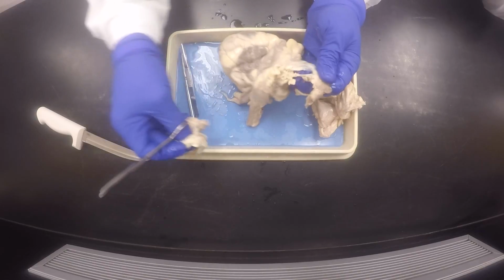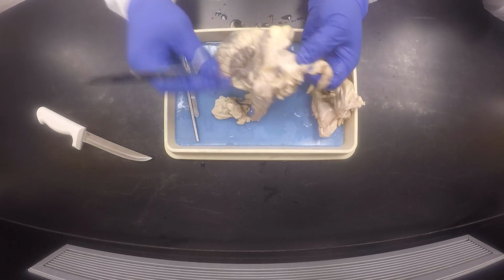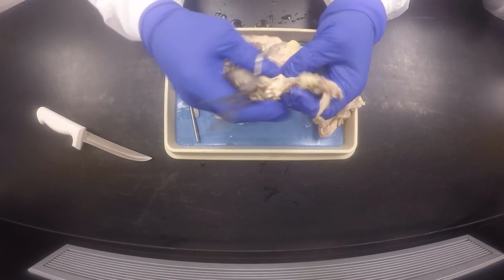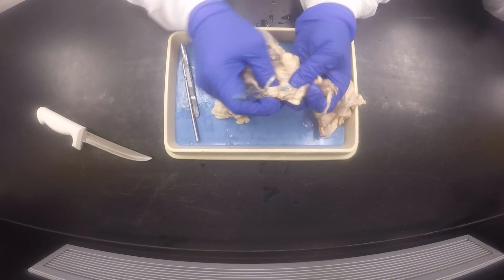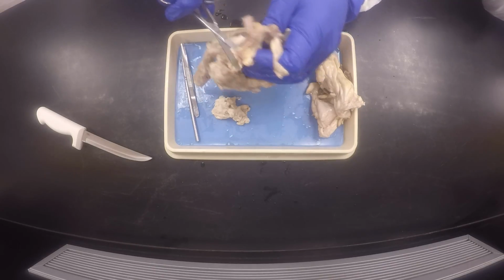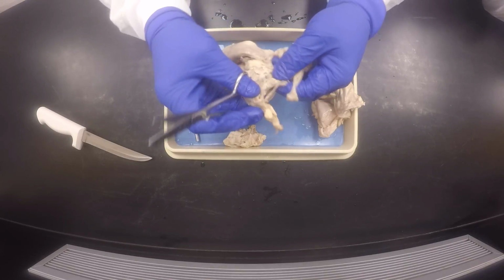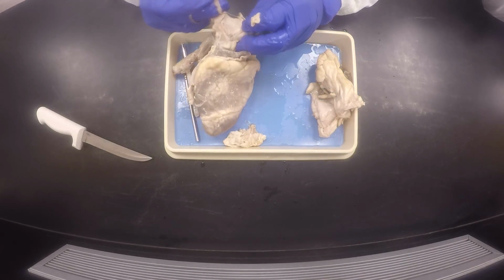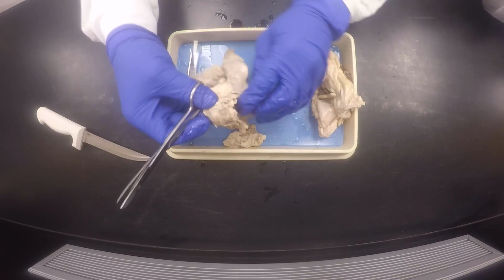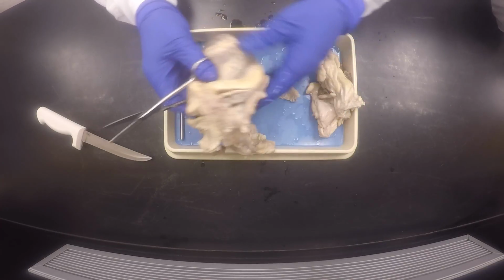Okay, so the first order of business is to identify the anterior side of the heart, the side that is facing forward like this when the heart is in your chest. You want to figure that out because that will tell you which is the right side, which is the left side, and where all these other blood vessels are located. In terms of the four major blood vessels into and out of the heart. Okay, it's all manageable now. It's probably part of the inferior vena cava.